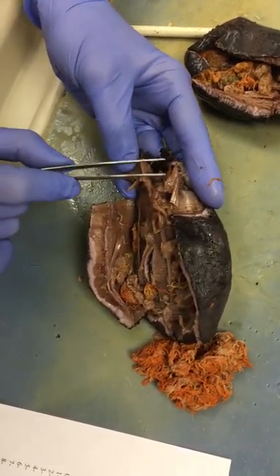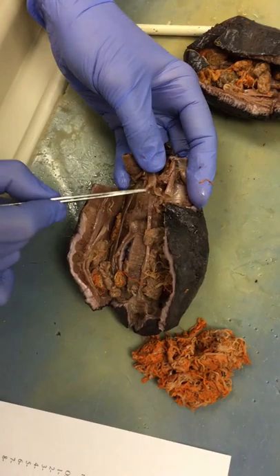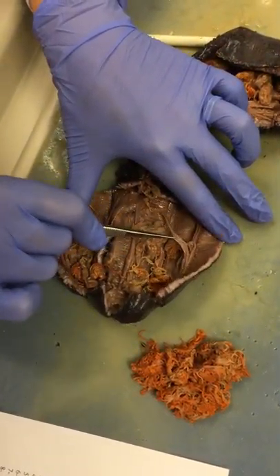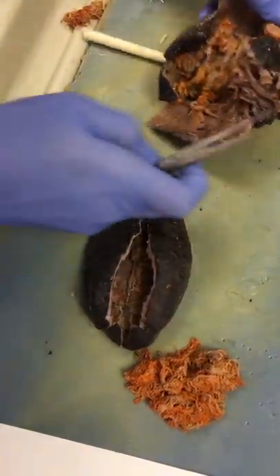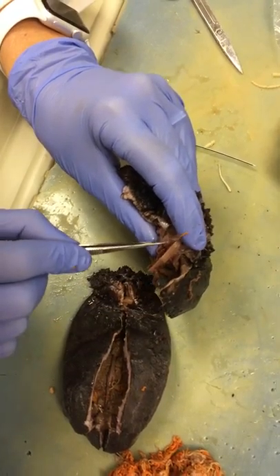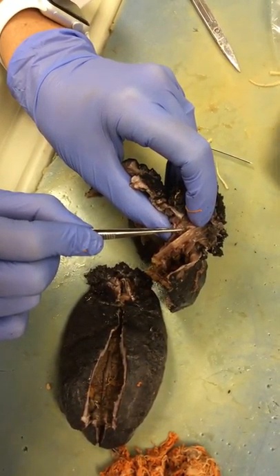So: mouth, pharyngeal bulb or pharynx, esophagus, stomach, down to the intestines — and then you can see the gonads here again, the retractor muscle, and the longitudinal muscle. In this one, you can actually see the hole where the radial canal is flowing from.